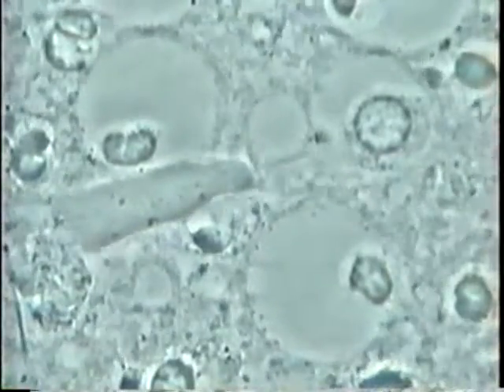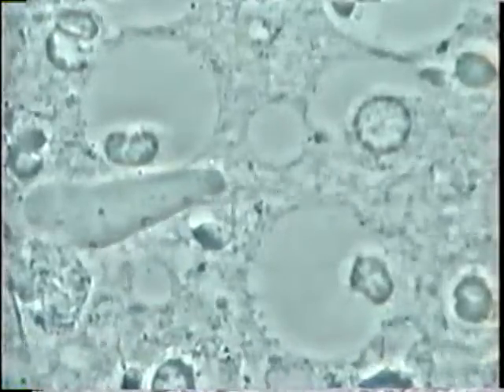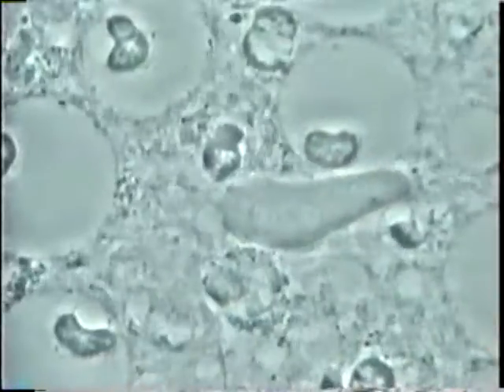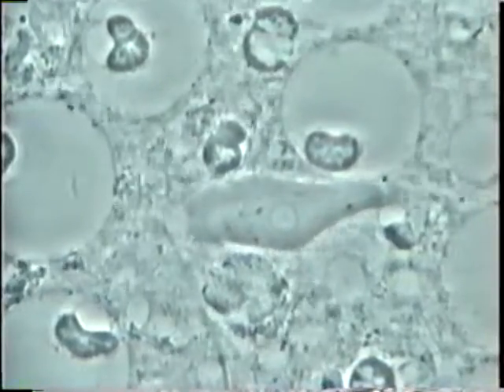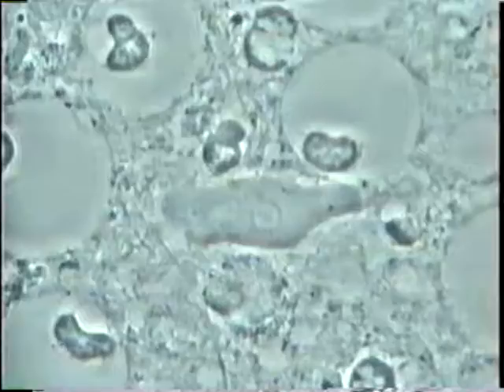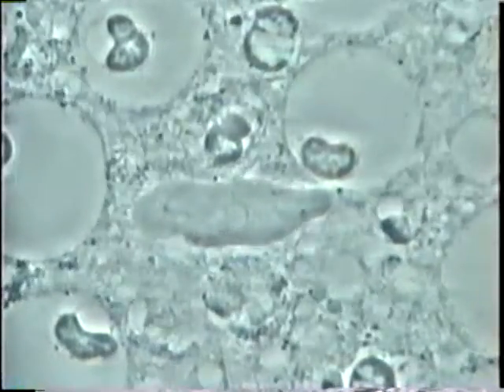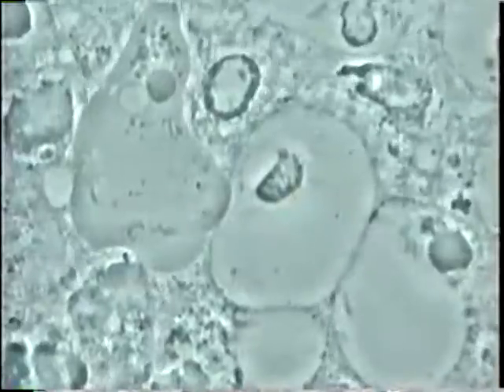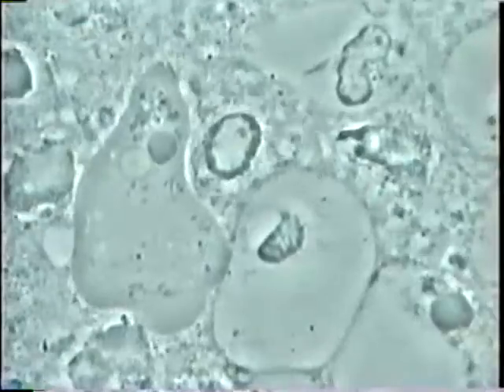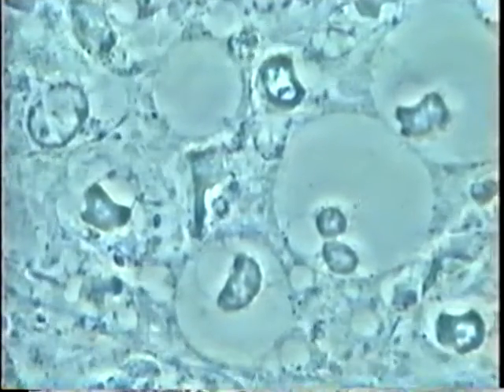This is a typical microbiota of gum disease — chronic or aggressive gum disease. You see many mobile bacteria, many white cells — round cells with the nucleus inside — and in the center, one amoeba. It is a parasite, an animal parasite that is inside your gum when you have gum disease. You see again a big parasite in the center and many white cells, so there is a lot of pus inside the gum.